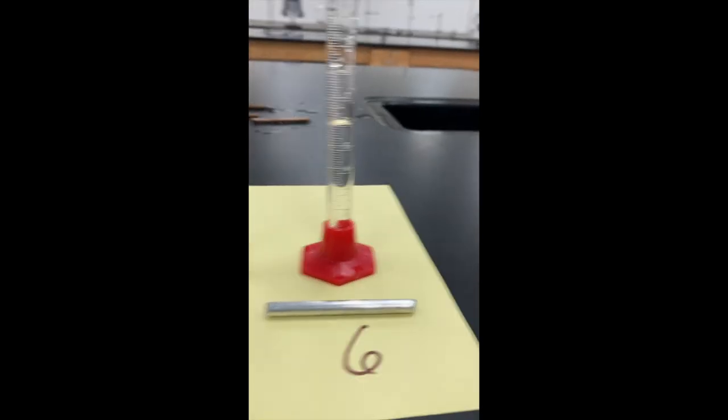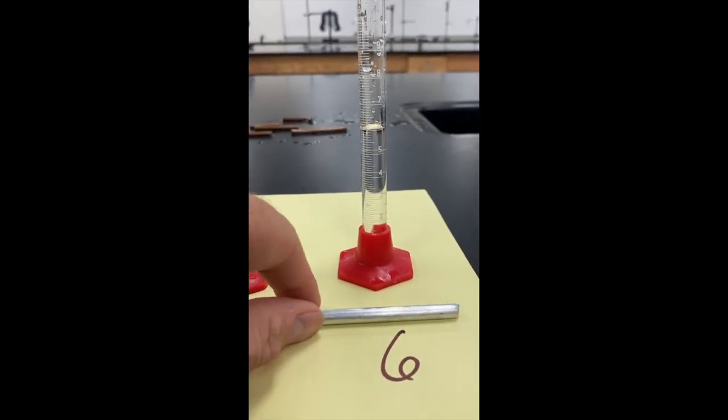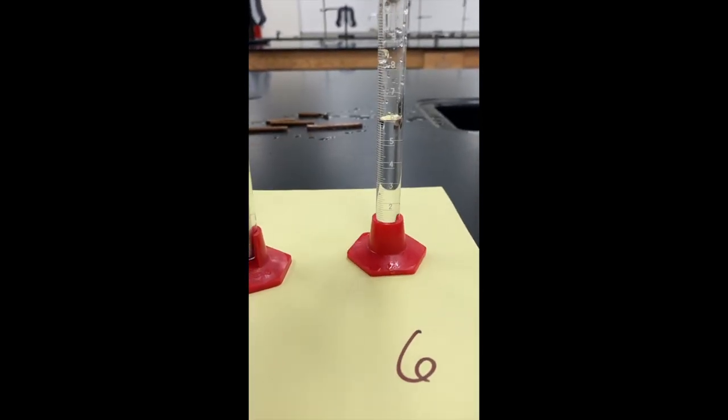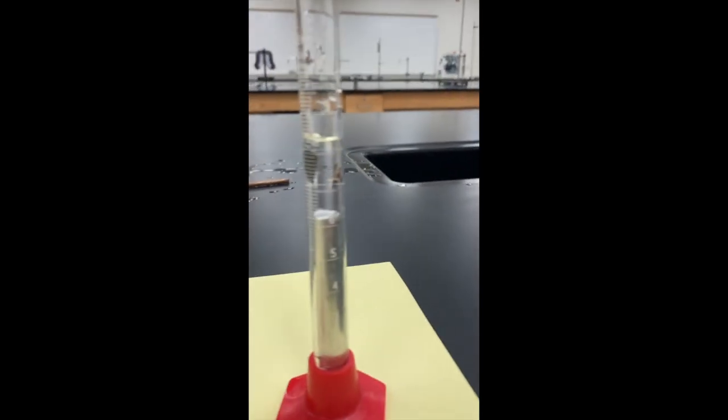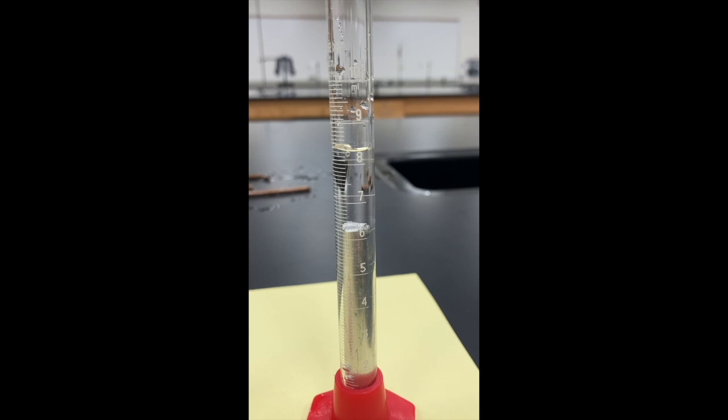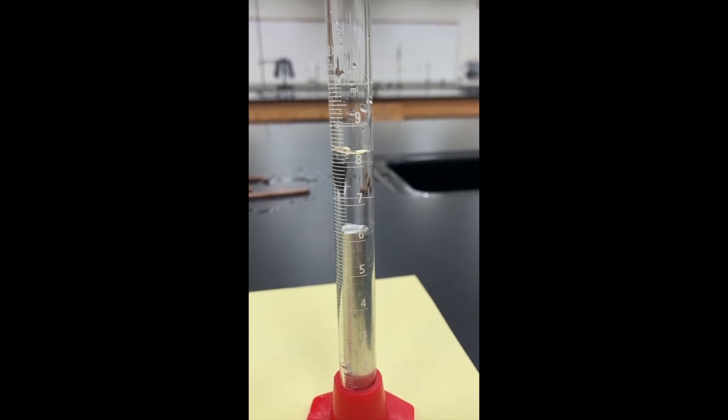And then last but not least, number six. So we'll put that one in there, let the bubbles come to a rest, and we'll take a look at the water level and read from the bottom.